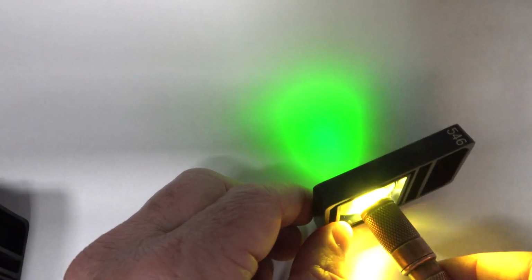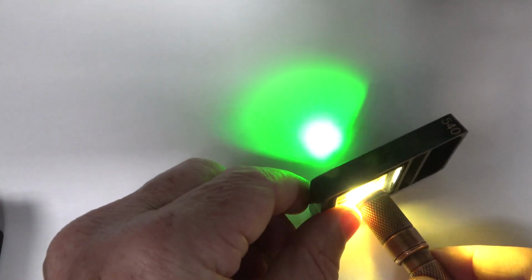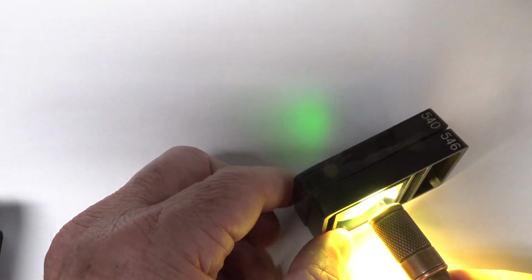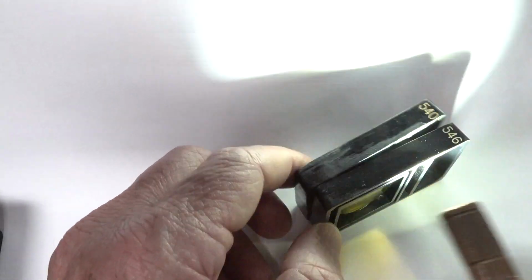Sorry if it's a bit overexposed. It looks different on my camcorder screen because I've got zebra stripes on. Anyway, nice green, that's lovely. That was 546, and here's 540. Each one may not have the same bandwidth. In fact, they're probably different. But look at that, 546 and 540, that definitely gets through. So it's somewhere from 6 nanometers to 30 nanometers, something like that, if I've got my mathematics correct.